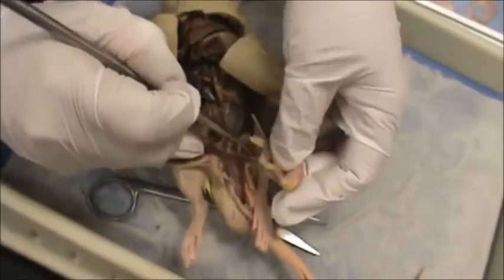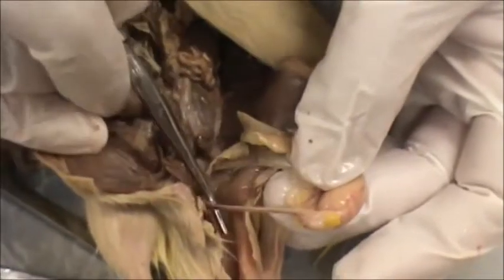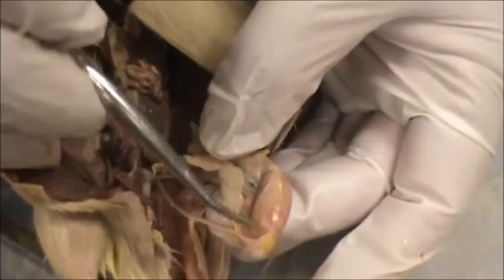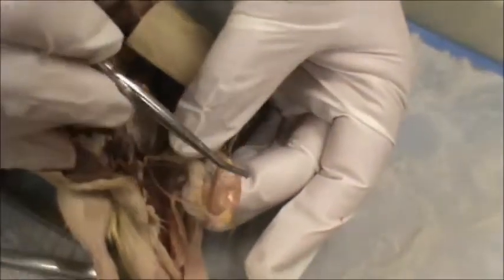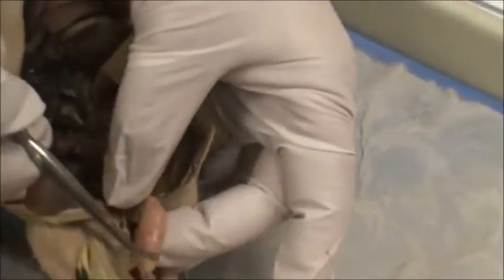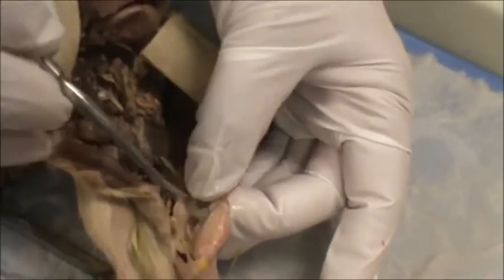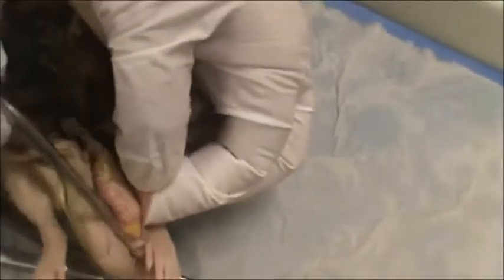Then comes the vas deferens, which is a tube that leads to the epididymis, where sperm is stored. And this round structure with the red little squiggly snake on it is the testes. The testes, the epididymis, and the vas deferens are all contained in this skin called the scrotum.